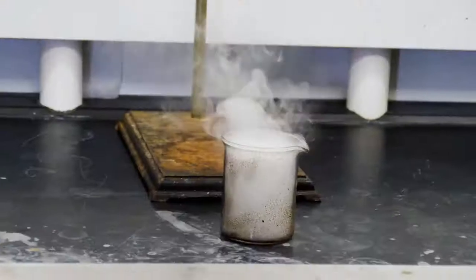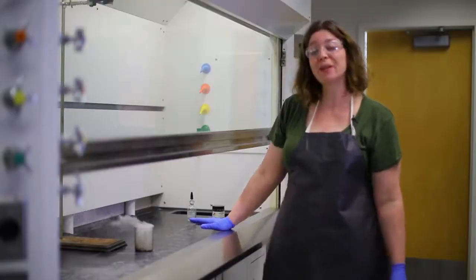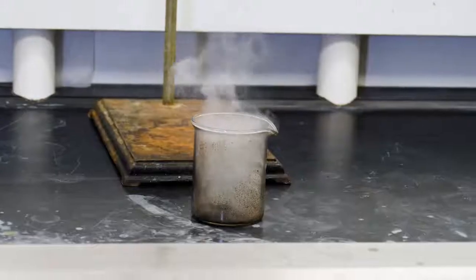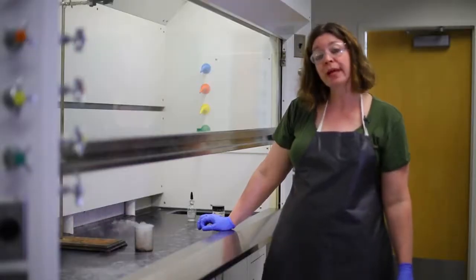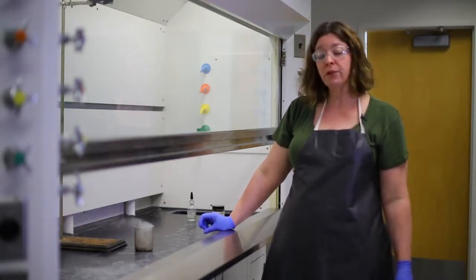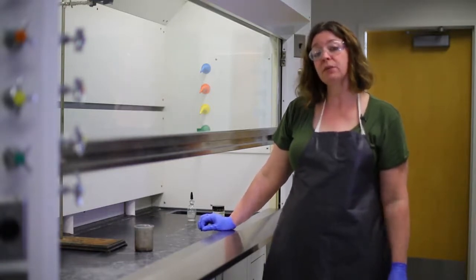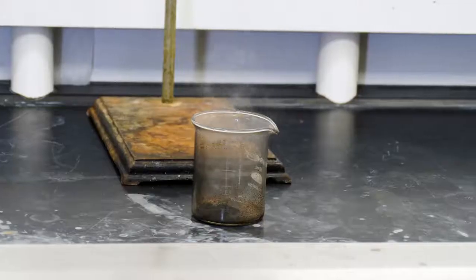Potassium compounds frequently burn purple or violet. When you look at fireworks and you see that purple flash in the sky, it's usually a potassium-containing compound, like potassium permanganate. So we want you to be aware of directions, and we want you to not randomly mix materials together. We're not going to send you many reactive chemicals in your lab kit, but it is important to follow directions, because if you mix the wrong things together, you could have something like this result.